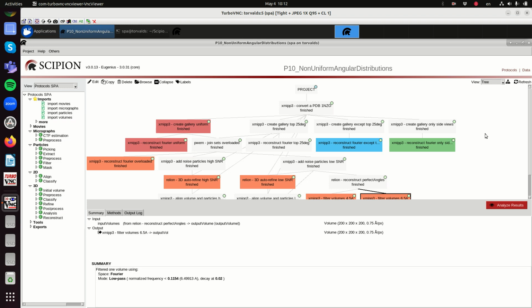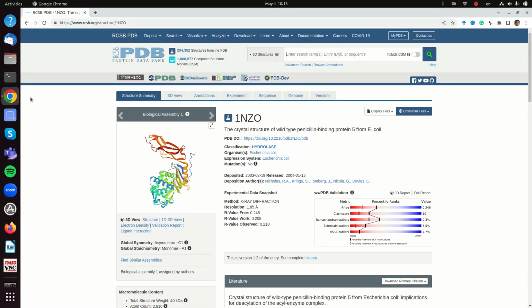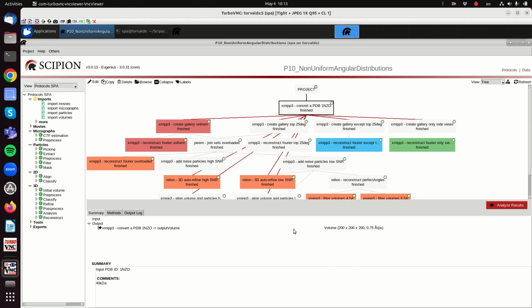Explore the relationship between the angular distribution and the 3D reconstruction, and also the interplay between noise and angular distribution. So we start with an atomic model. Again, I'm using all the time this protein that is here. It is the wild type penicillin binding protein 5 from Escherichia coli, and it is a small molecule, only 40 kilodaltons. But still, as we said in our previous videos, it is not just the weight, it is the signal to noise ratio. As long as we have enough signal to noise ratio, we should be able to analyze it.